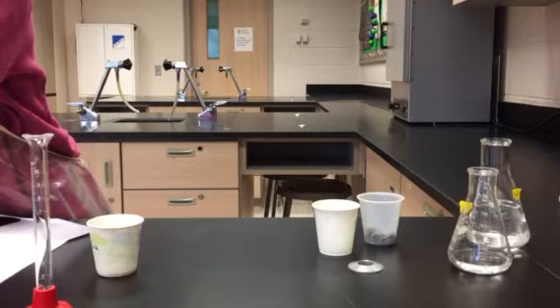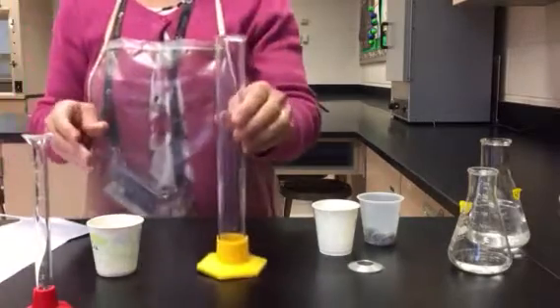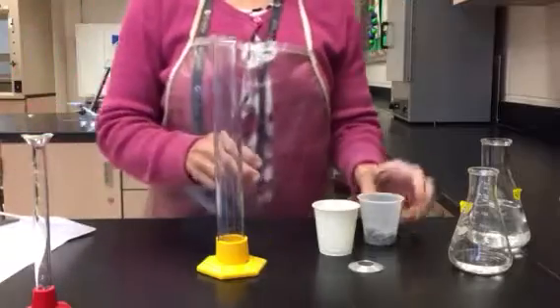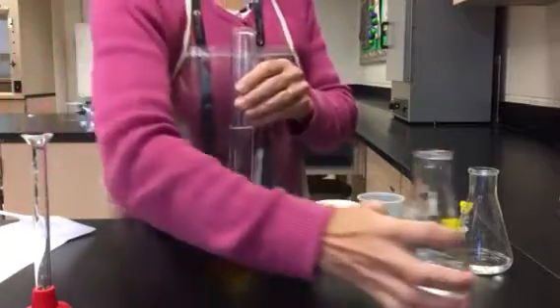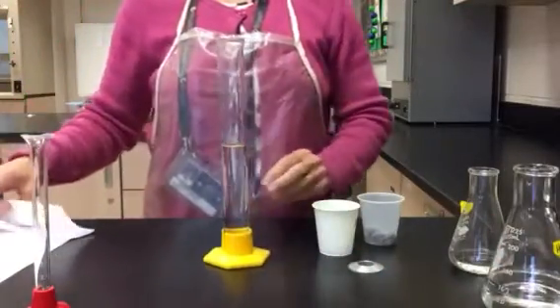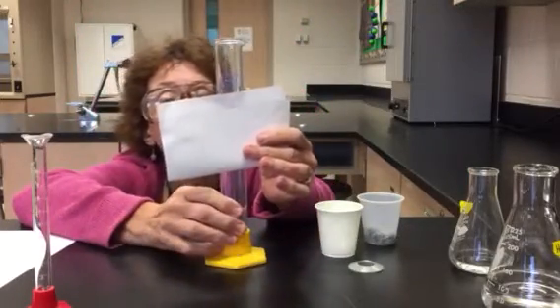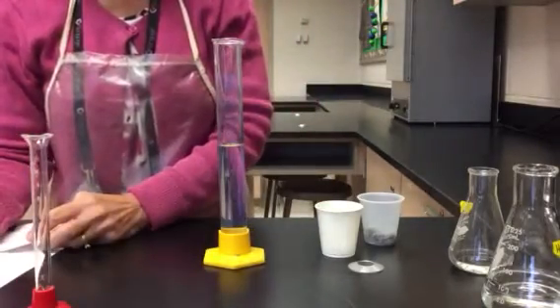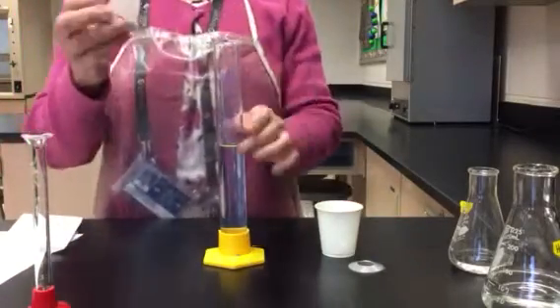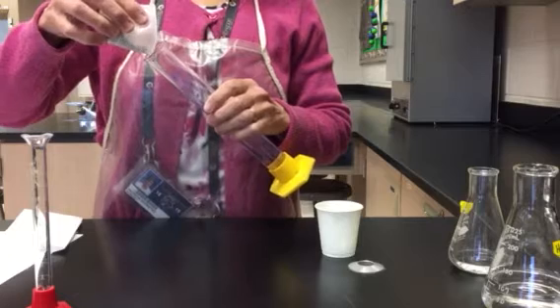All right. Now I'm going to do that again with the next metal. So again, I have my graduated cylinder. I'm going to fill it halfway with water. I'm going to go ahead and record the volume. And it looks like it is reading 64.9 milliliters. Then I'm going to go ahead and add my metal A into the graduated cylinder, gently again so that I don't splash.